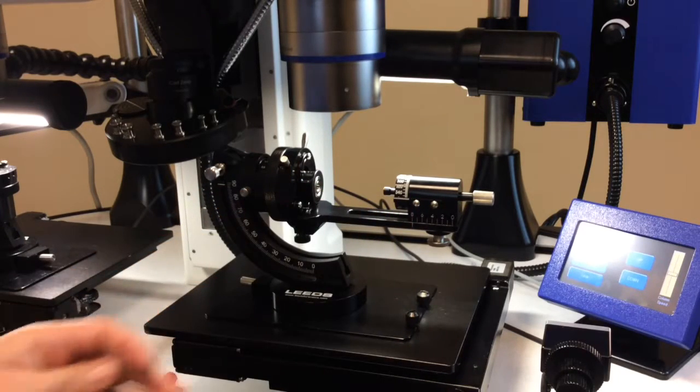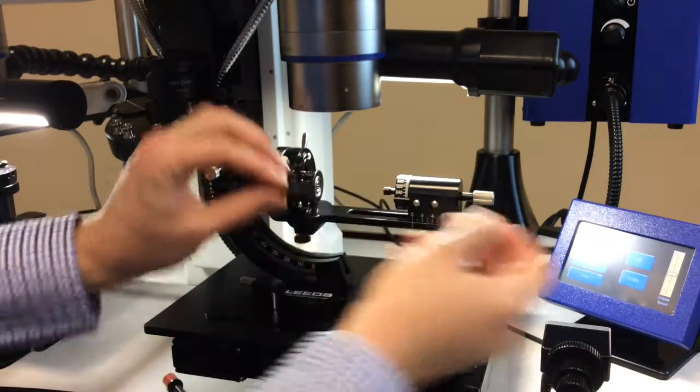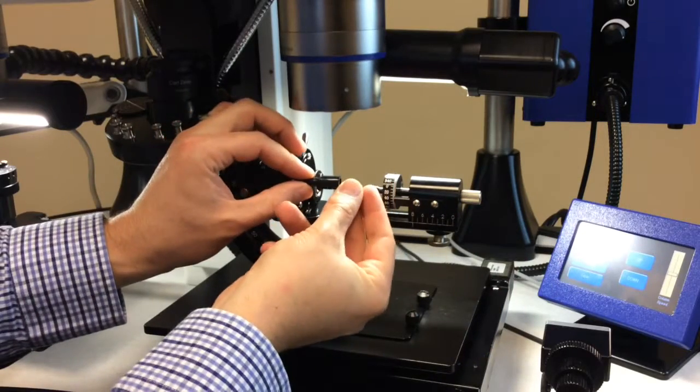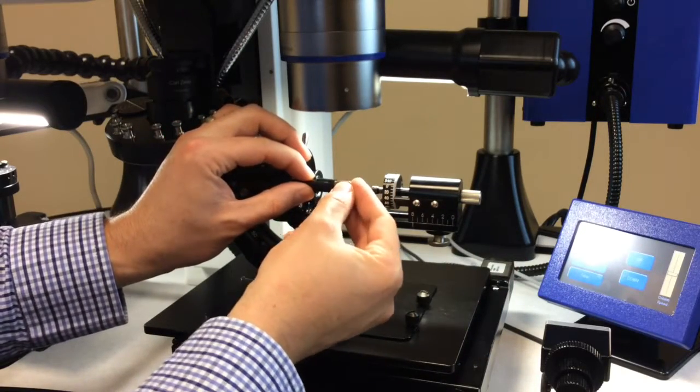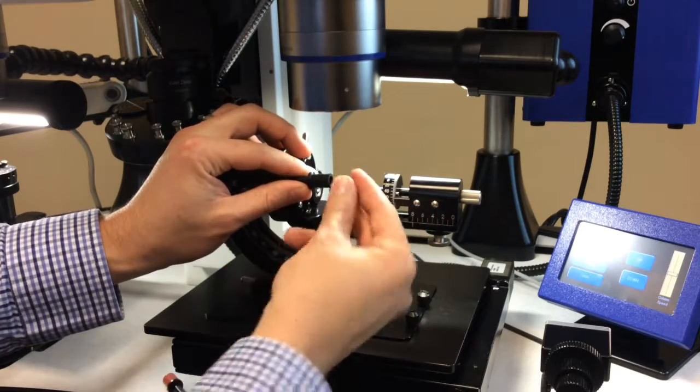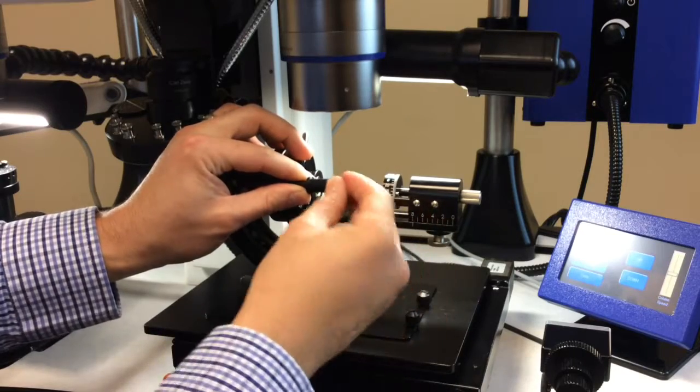A quick note, the idea of these caliber-matched inserts is that when the holder is activated, the spring-loaded portion back here is going to press against the back of the bullet into the holder insert. And then this is what's going to rotate in place. We use a rubber here so you can move the nose around as you need to fine-tune your centration.